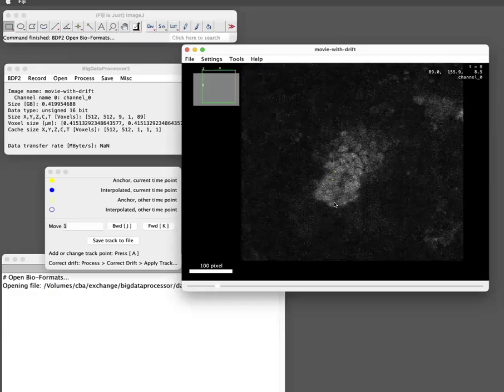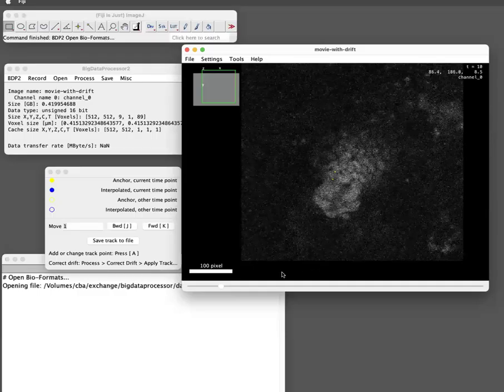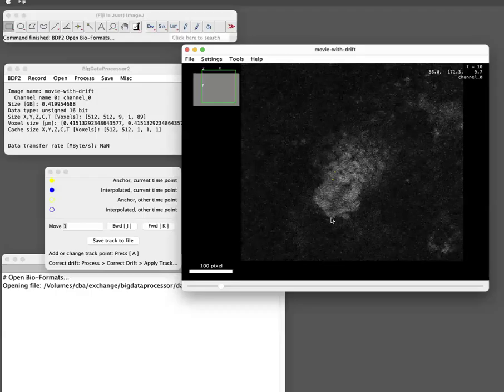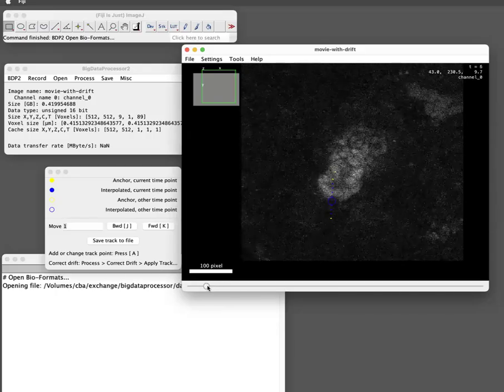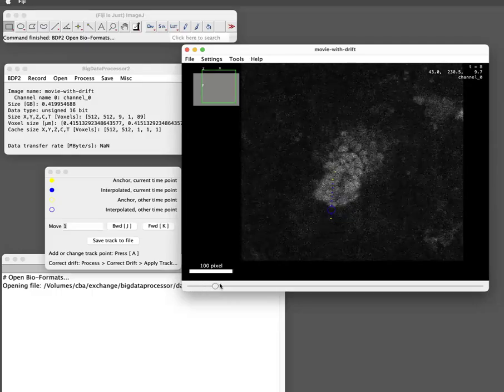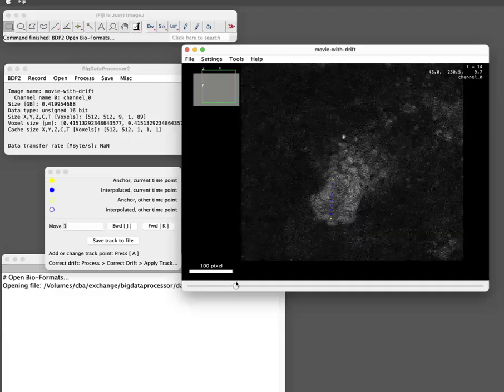Let's move a few time points further. Go up and down in that. Okay, maybe here is the tip now, so I press A. So what happens now, you see it actually interpolates the drift positions that I have not annotated. I only annotated in the first 2 time points, then I skipped a few and I annotated again. So everything that you did not annotate will be linearly interpolated. And you can actually see where that would be. It's not too bad. So that will save you a lot of time annotating.